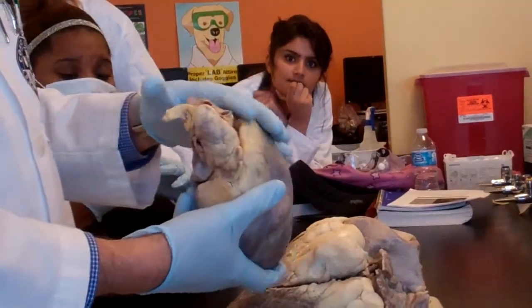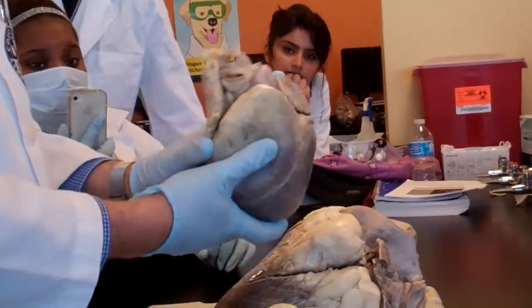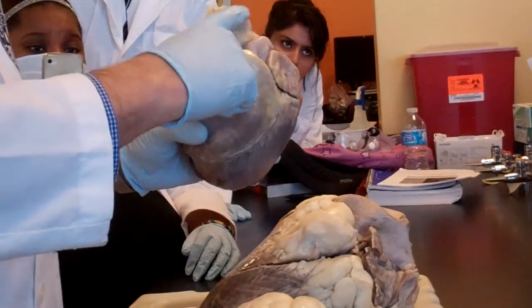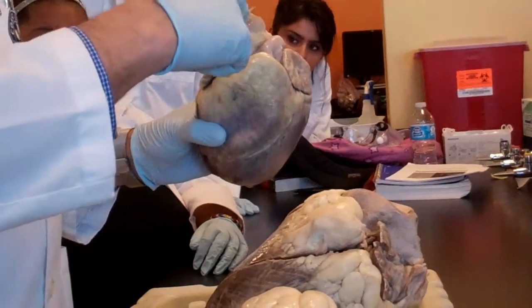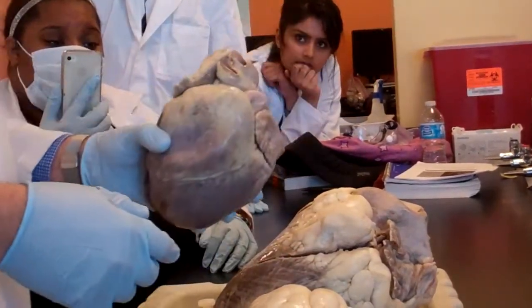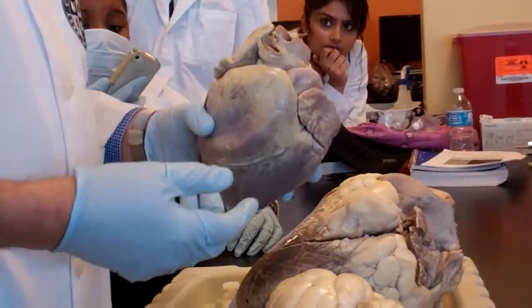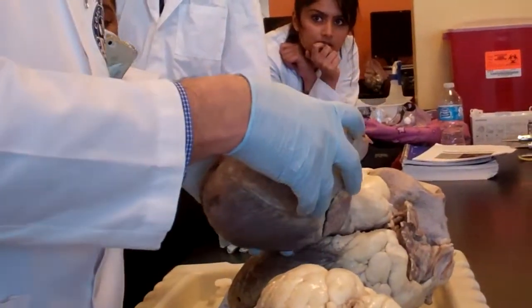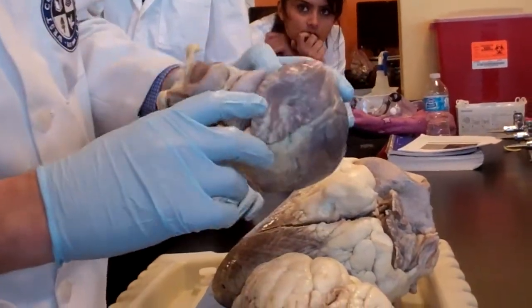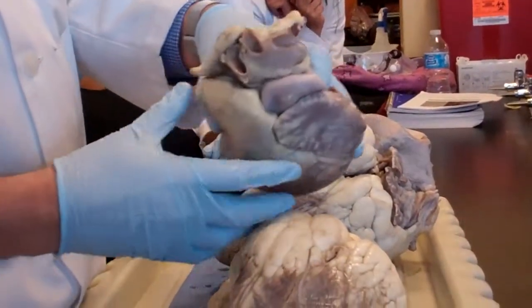I see very clearly that from the anterior surface I have the C shape, pulmonary. Okay? And I see with my little eyes the aortic arch. It's very clear. Why did I say that this is the aortic arch? Piece of cake. Because it's holding itself. It's giving me a certain structure. I can see the structure right there. It's open. It's wide open.